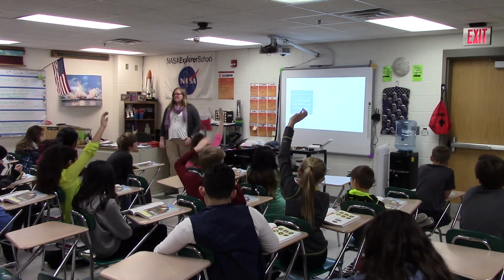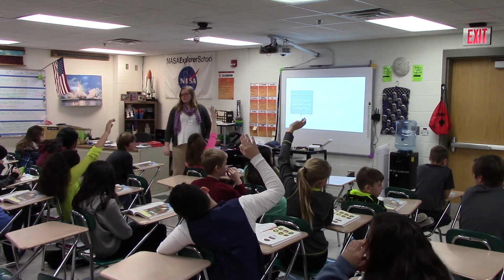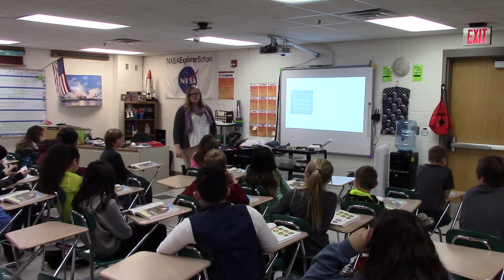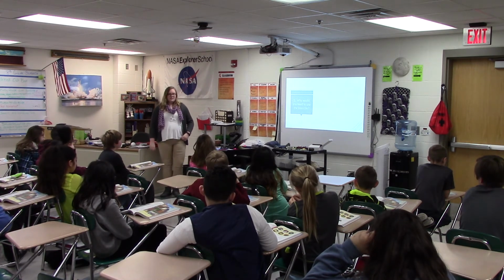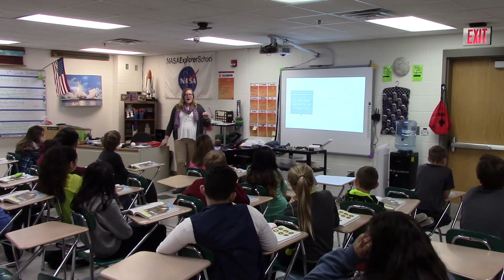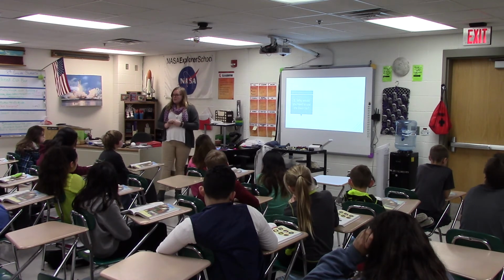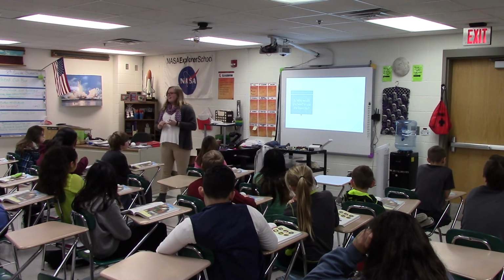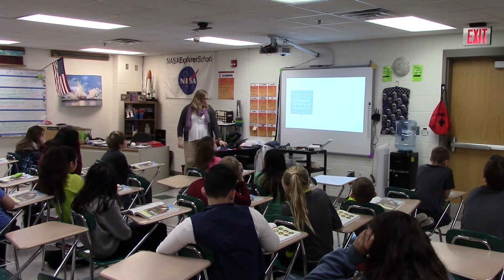Someone want to help him? Nevaeh? Yeah. So if the color does not show up on the white one first, it might be either a white streak or it could be a very light color. So that's when we go to the black tile next.